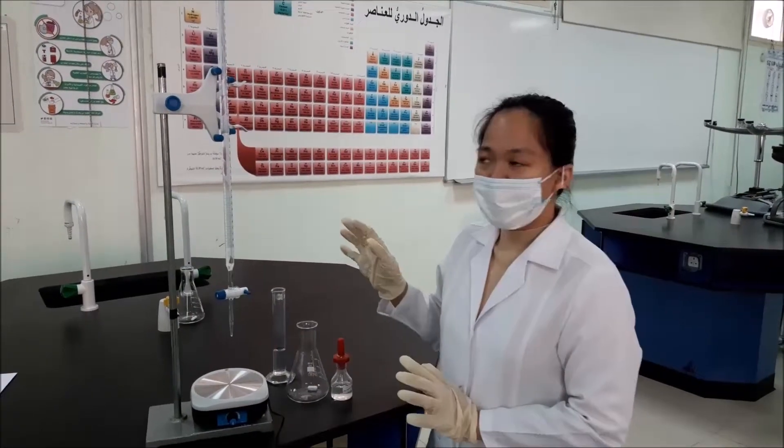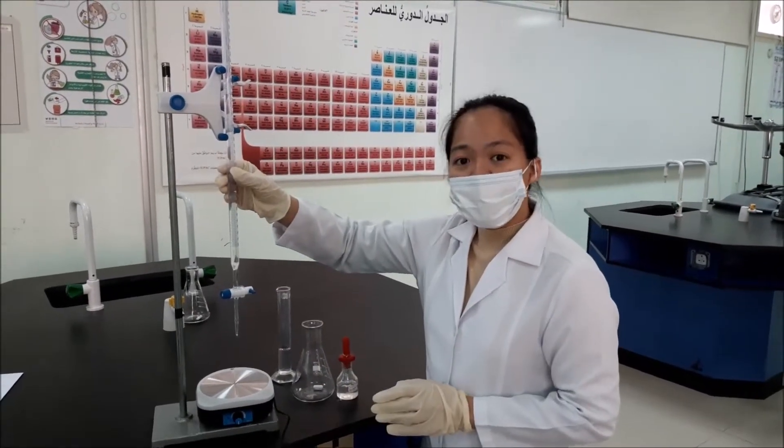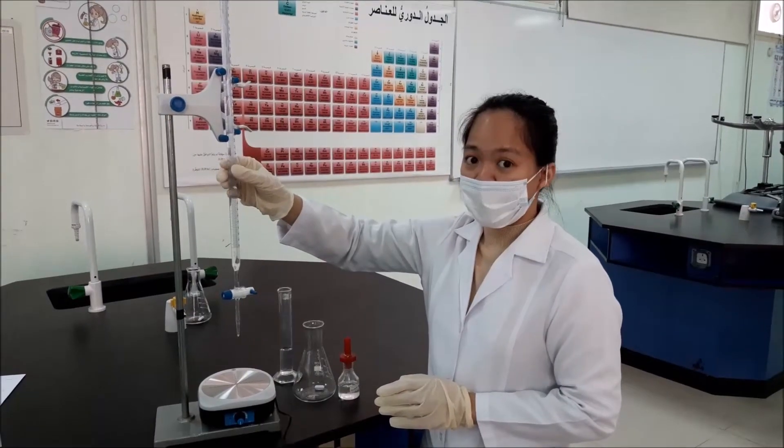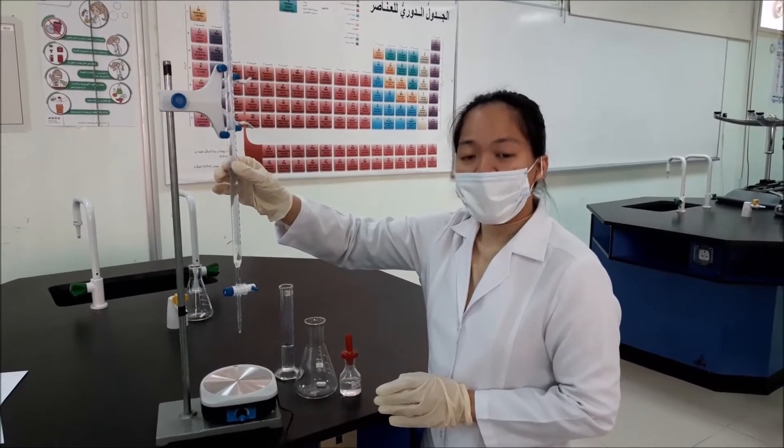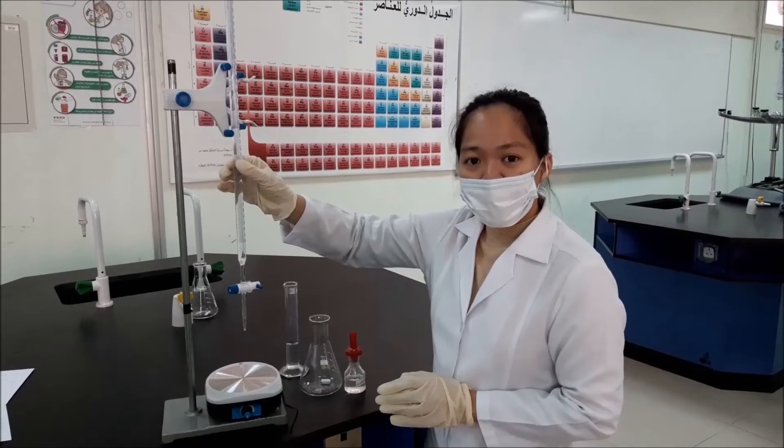Good day! Today we will do the titration between sodium hydroxide and acetic acid. In this experiment, I put the sodium hydroxide in the burette. This sodium hydroxide has a concentration of 0.6 molar.